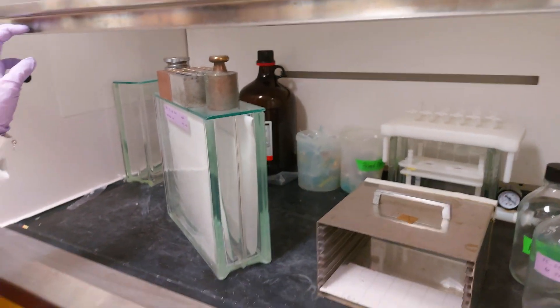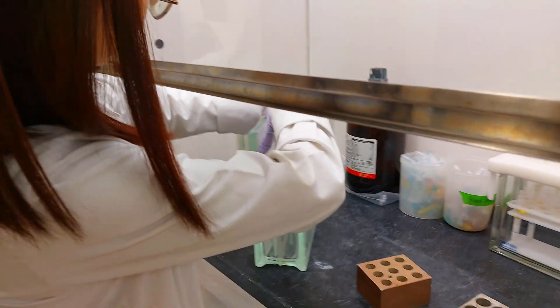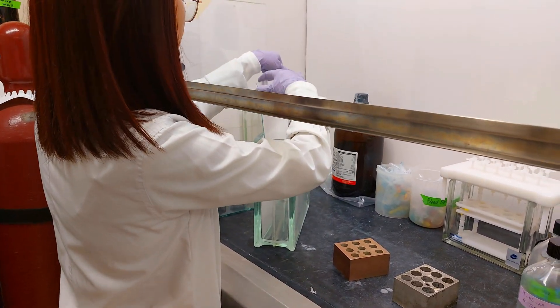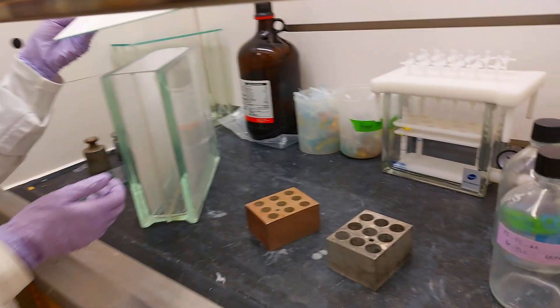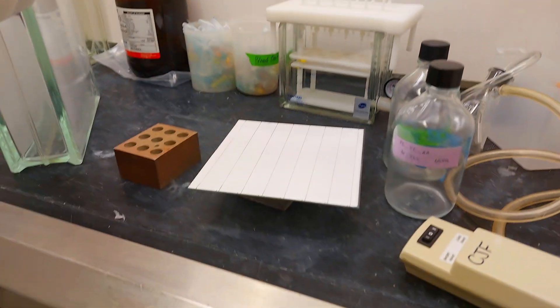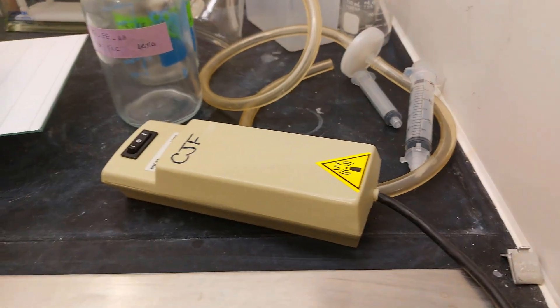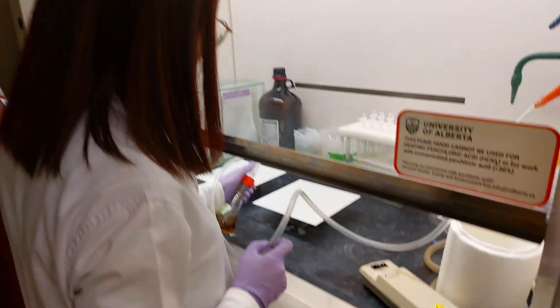We'll give it about 20–25 minutes. Once the solvent front is about a quarter inch from the end of the plate, you just gradually pull them out. Then just put them here to dry for about two to three minutes. You can't really see anything yet — until we spray them and use the UV light to visualize.